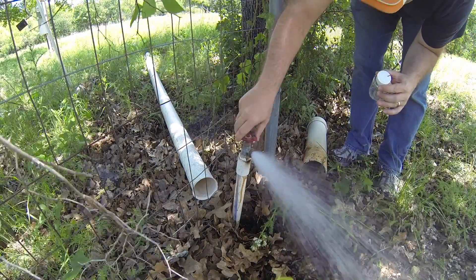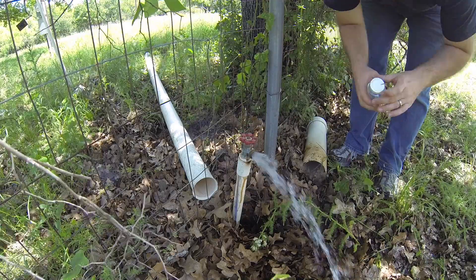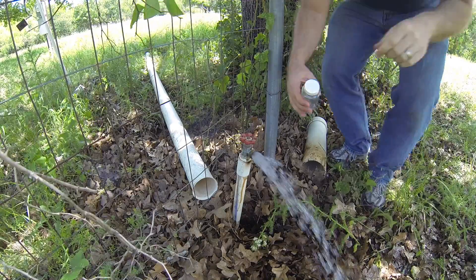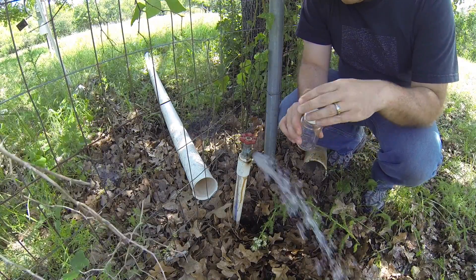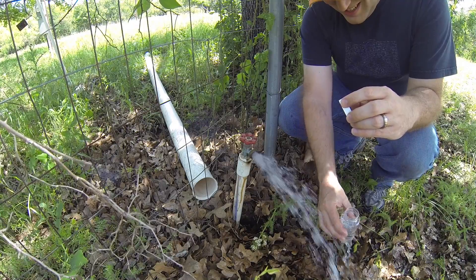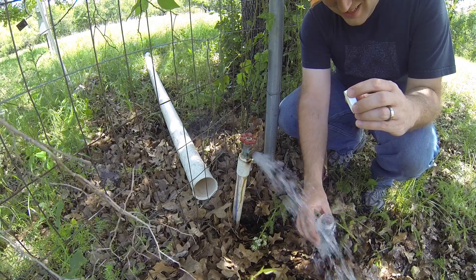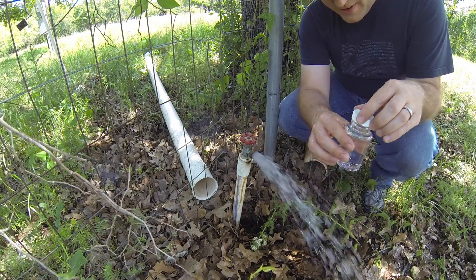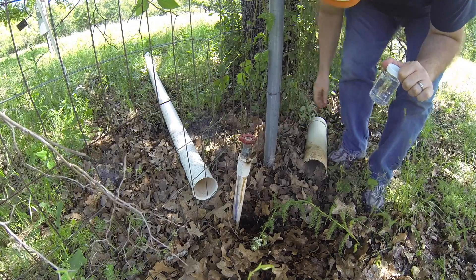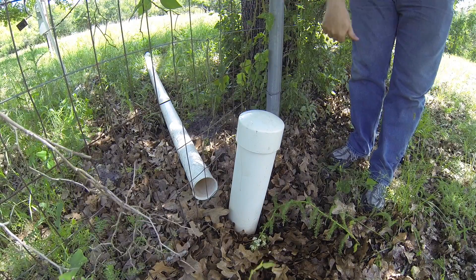I'm back with my sample jar. I'm going to turn this thing down to a low steady flow. I'm going to open up my sterile container. I'm going to fill it up to 120 milliliters just like before. Don't overfill it. It's tight on there. I have this cover over it — it's hot though. This is supposedly to keep it from having problems when it's cold.